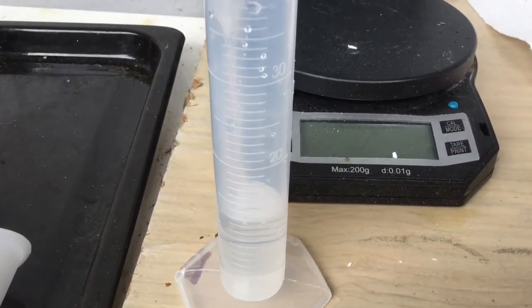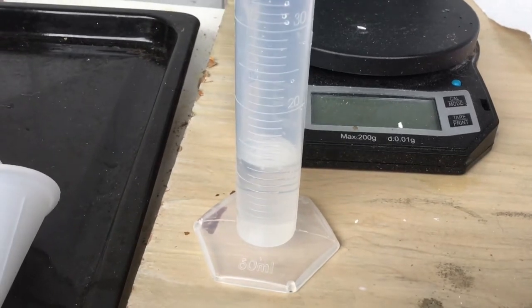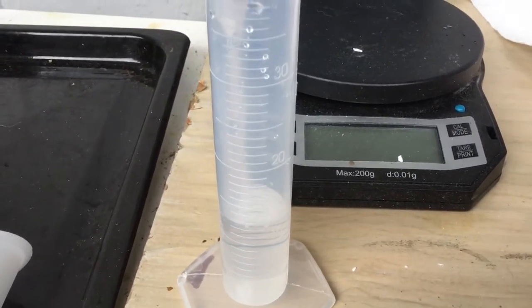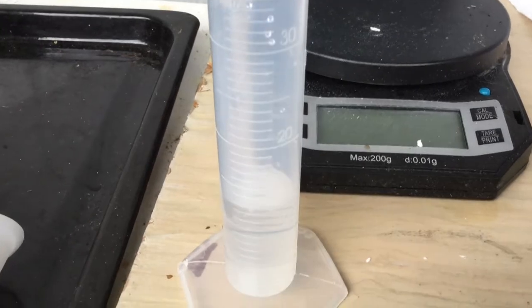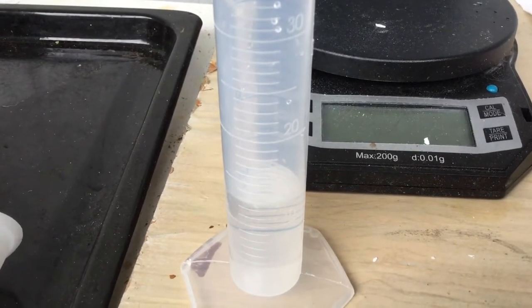It looks like we've used 88 milliliters, because I actually used 100 milliliters of one molar sodium hydroxide solution, not just 50.